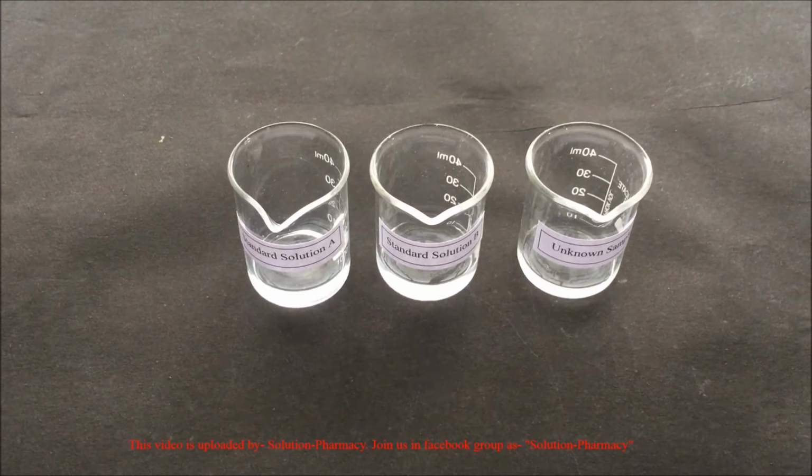Draw a starting line about 1.5 cm from the bottom of the filter paper with a pencil. Draw another line as the end line at the top of the filter paper, and this is the line up to which we allow the mobile phase to move. Mark 3 equally spaced points with a pencil on the starting line, on which we apply the spots of the sample solutions.